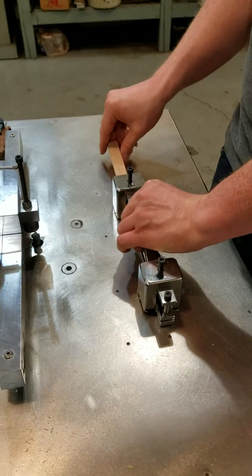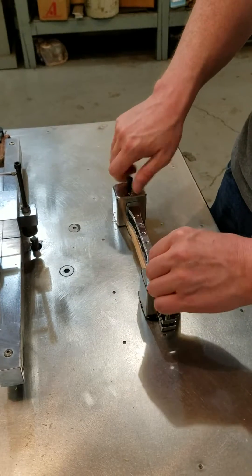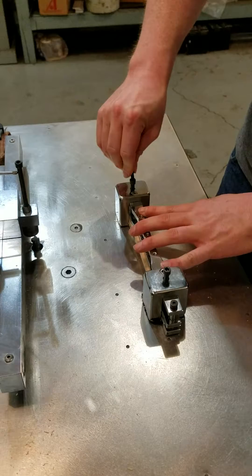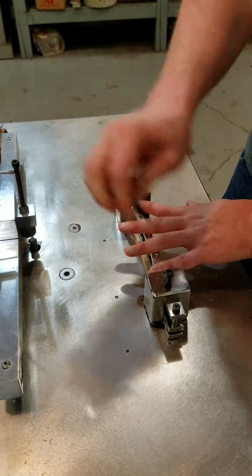Open your template up, slide the strip on the side, tighten it down — just finger tight and click tighten with the Allen key.